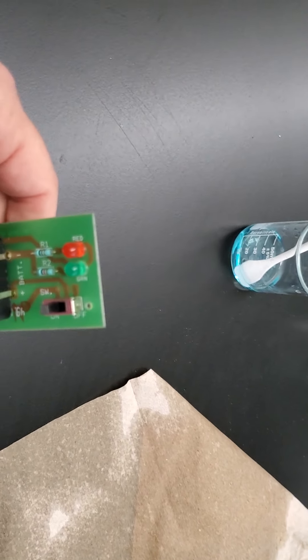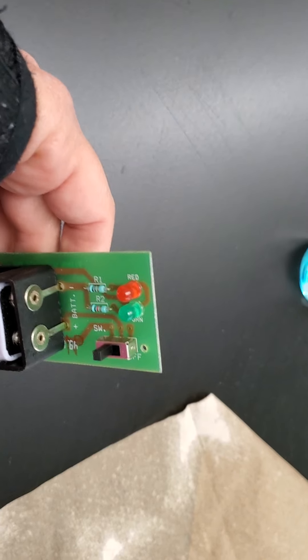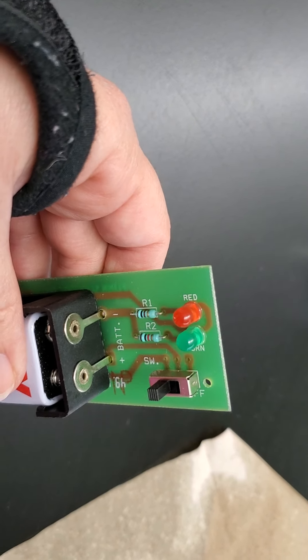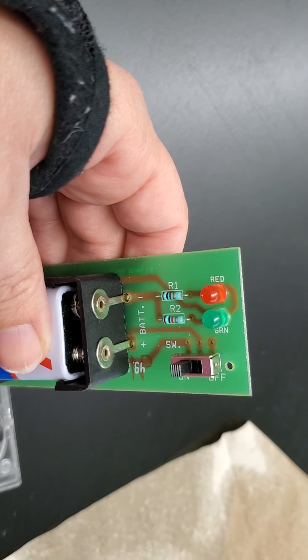We have to do number five again because for some reason my conductivity tester wasn't working correctly, and now it's not working again. I'm going to have to switch out the conductivity tester. I'll be right back.